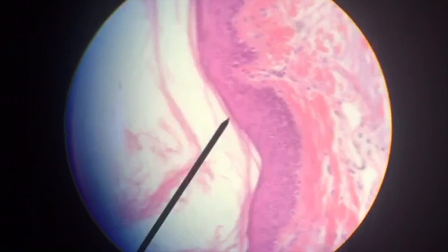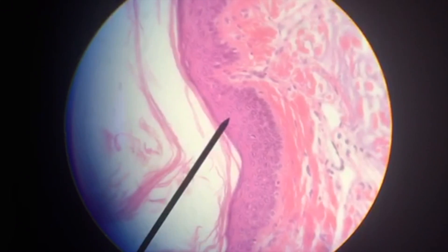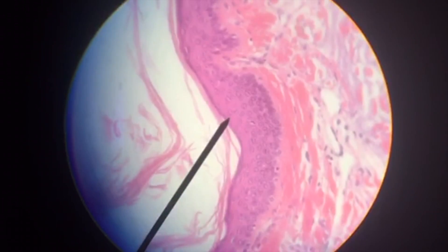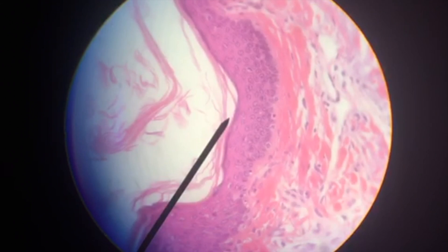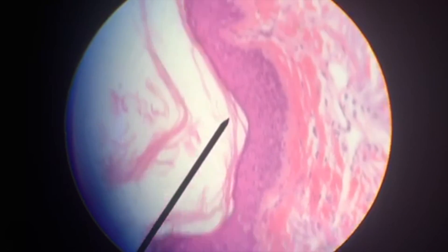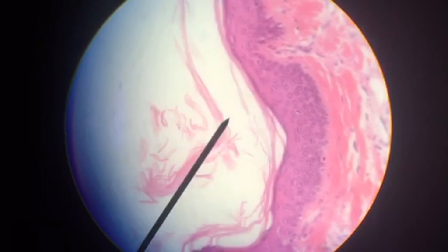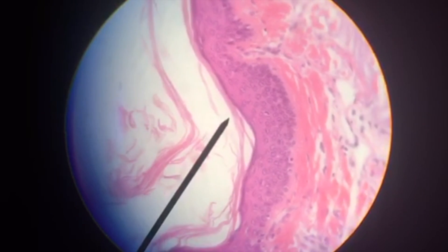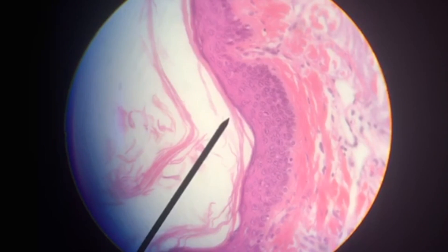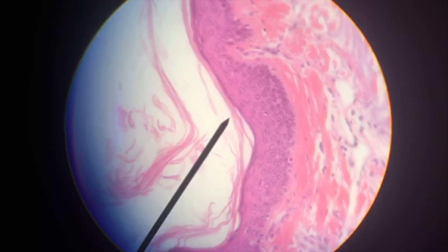Keratin is a protein modification that hardens and deadens the uppermost cell layer, allowing for waterproofing and protection. The pointer is pointing to that nice stratified squamous epithelium. We can see flattened cells stacked upon each other. Again, this is a good arrangement for protection against the elements of the outdoors.